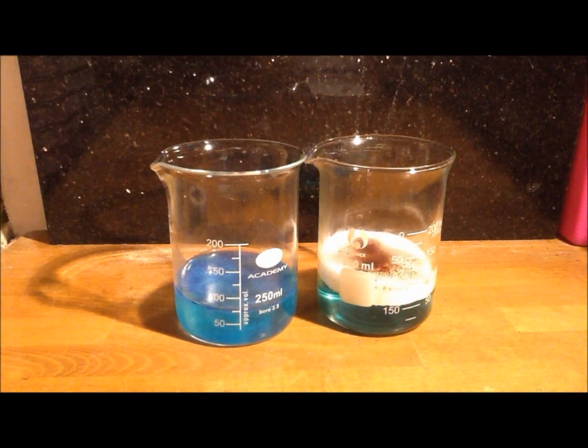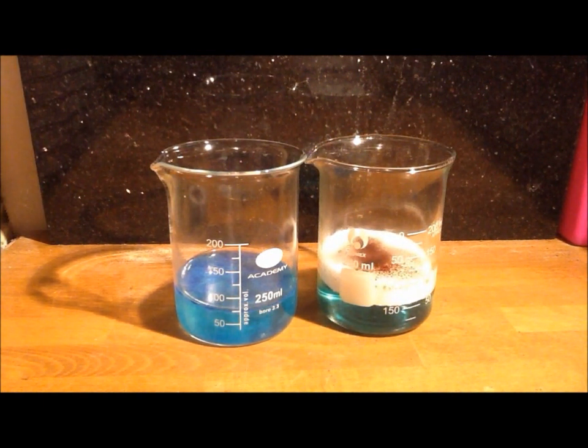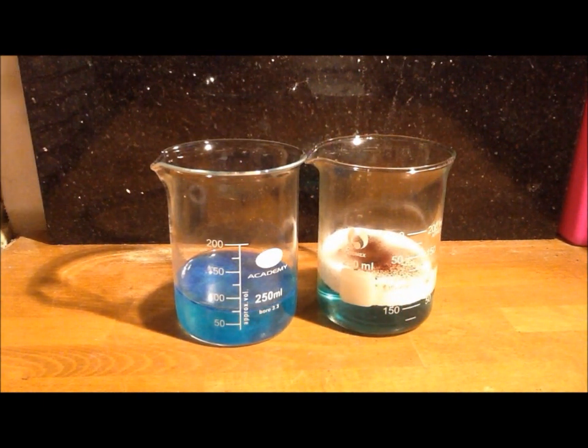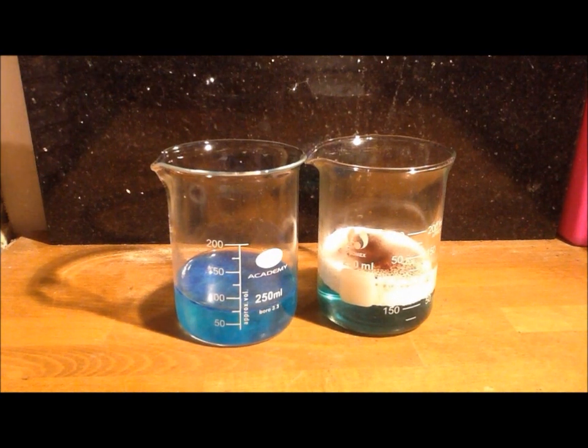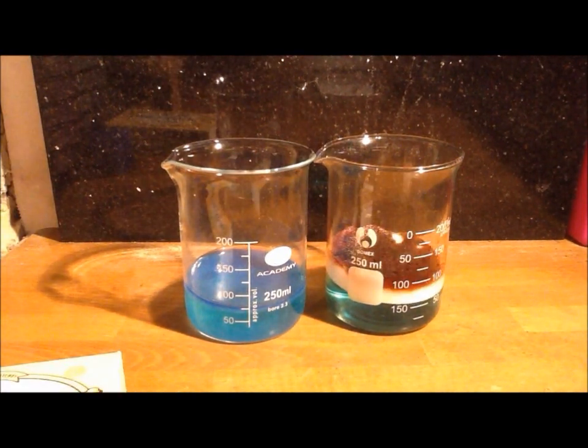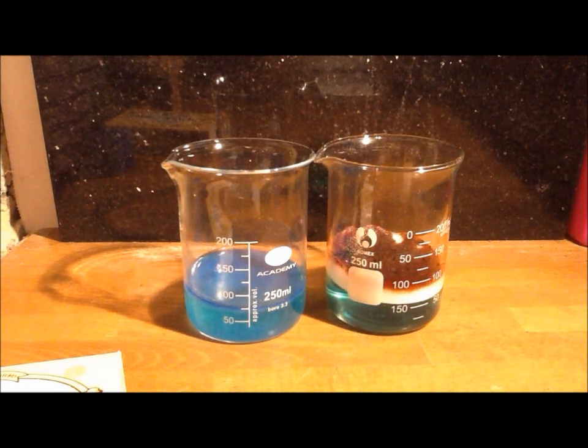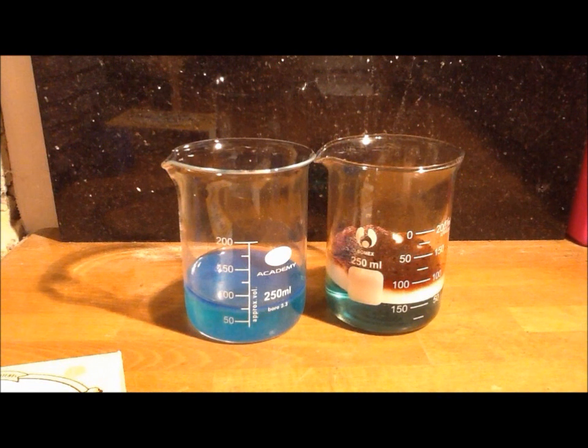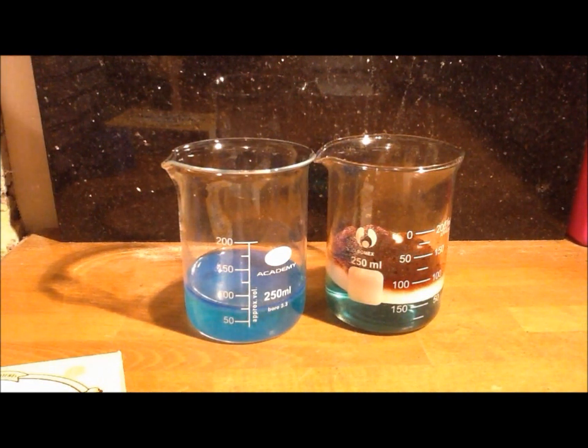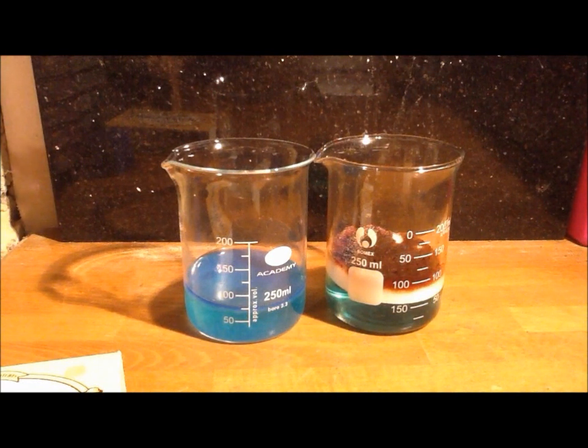So this confirms that it is oxygen based bleaching agent. Okay, so let's look at some of the chemistry behind this. If it is a chlorine based bleaching agent, it contains sodium hypochlorite, which reacts with hydrochloric acid to form chlorine gas. This is easily visible, so there's a good way to test for chlorine bleach.